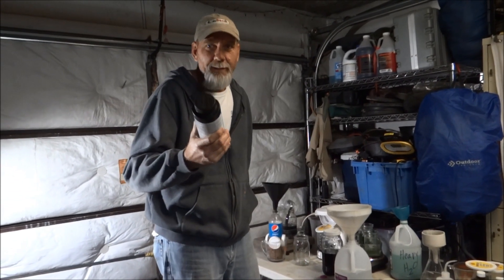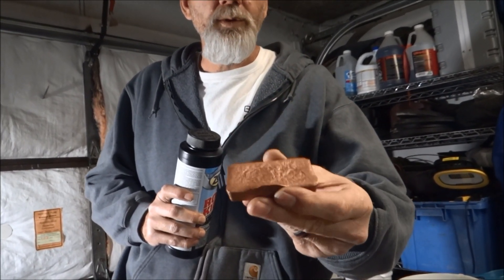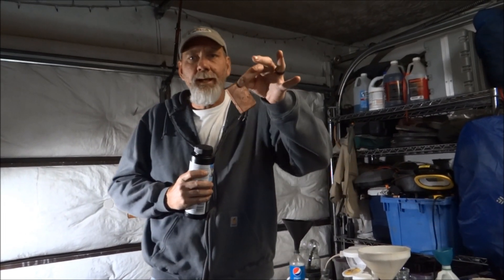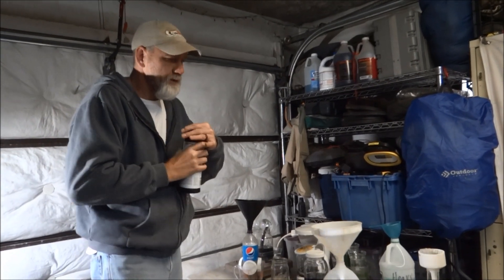Hey folks, 1881 MF here, Little Debbie Does Life - buzzing channel today. Look at this - this is a piece of copper that I poured from copper heat sinks off of old computers, and it's not totally pure. I want to make it totally pure. One of the ways to do that is to make a copper sulfate cell. We're going to take this and make it the positive connection, then take a piece of wire for the negative connection, and hook those back to power - not very much, one volt, nine volts, however much I slap in there. We got copper sulfate from the hardware store, it's for cleaning roots in your septic tank, and pure distilled water - so we have to make our fluid first.